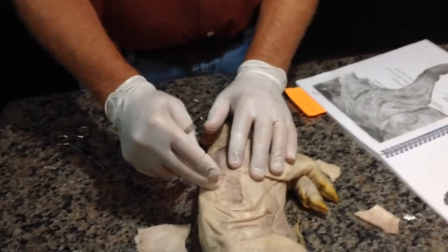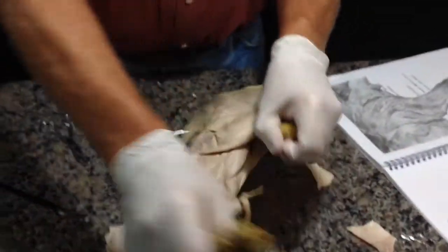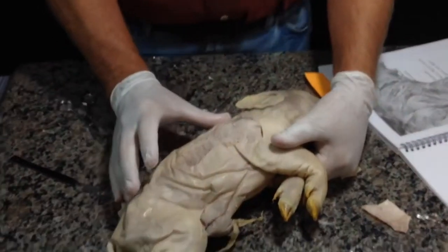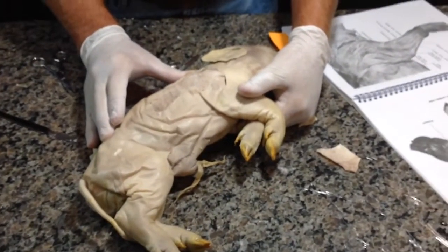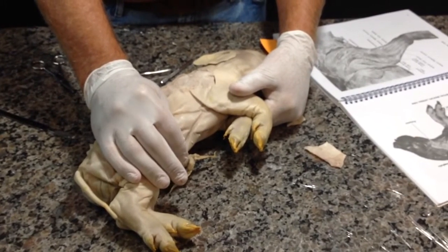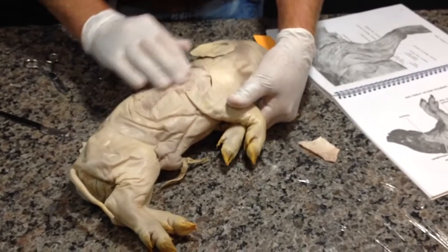It's a fetal pig. This pig has only eaten from the umbilical cord. So we're not going to find fat in this pig other than what this pig is born with. The mother has provided the nutrients through the umbilical cord for this pig. So that's kind of cool. So we see very little fat.